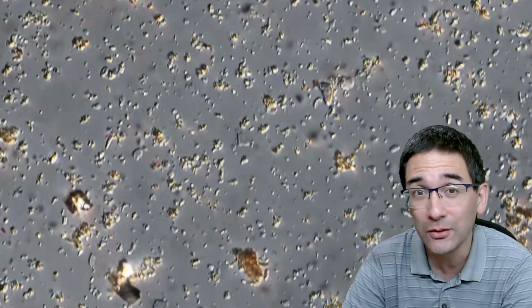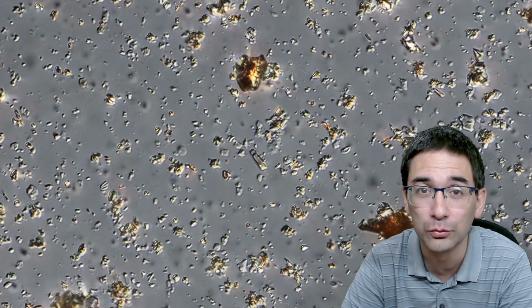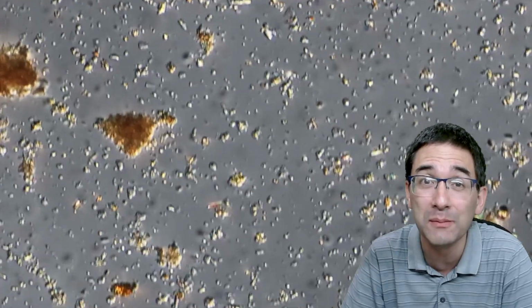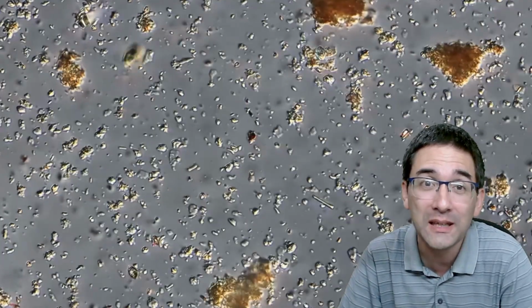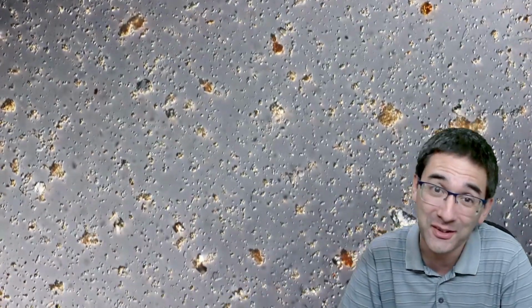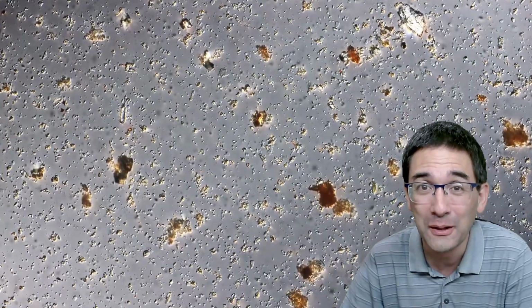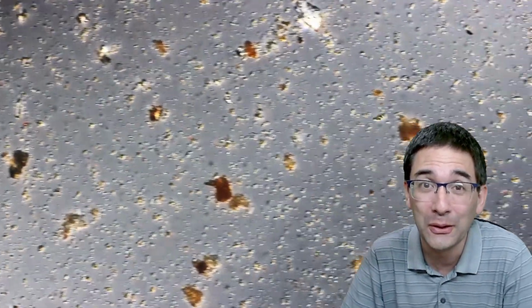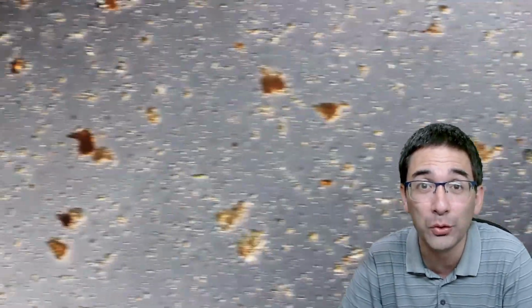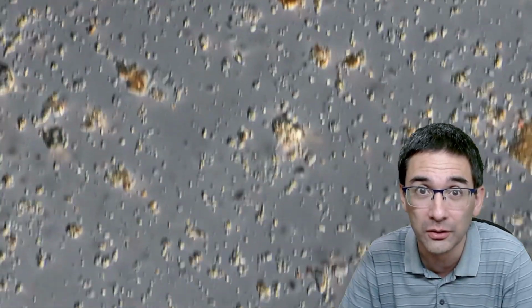It's been raining recently, and this means that there is a layer of new sediment in the little brook. And this means I took something from this newly deposited sediment. There was simply not enough time for many interesting water microorganisms to settle down there. And also another reason, which I found out later when I collected a sample from the pond: because it was in the forest, there were not many photosynthesizing algae in the little water river there.